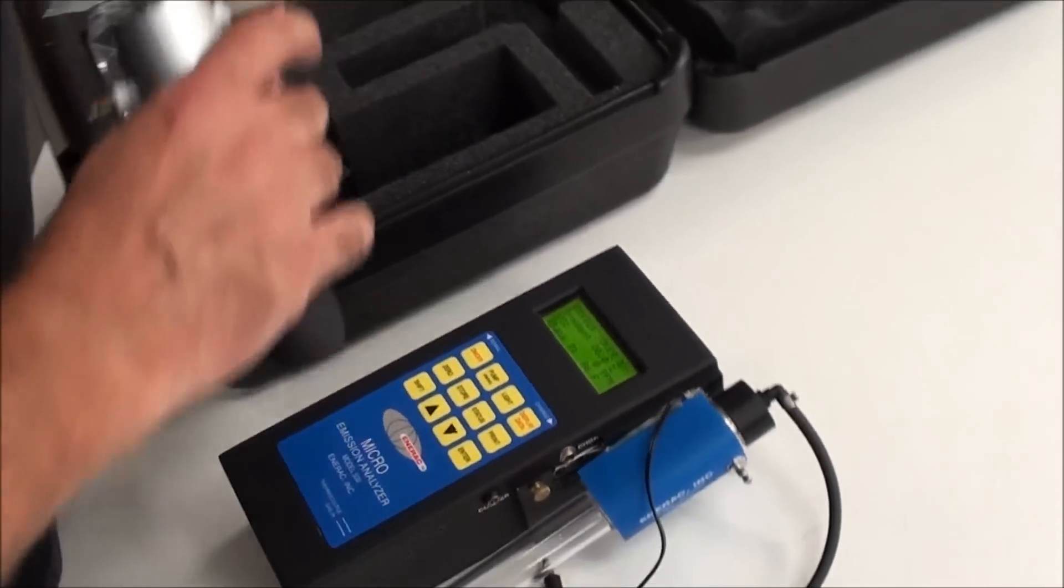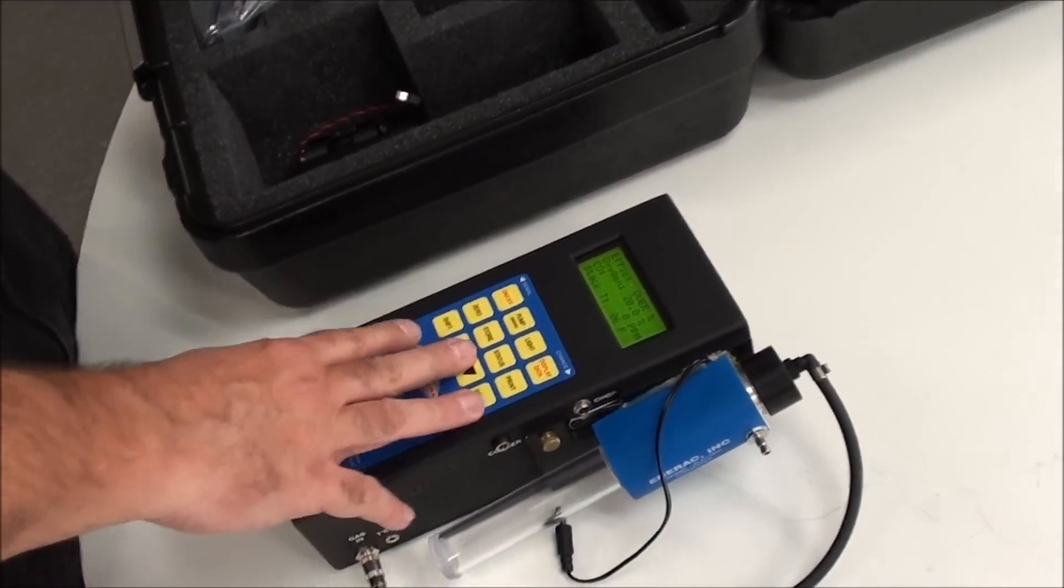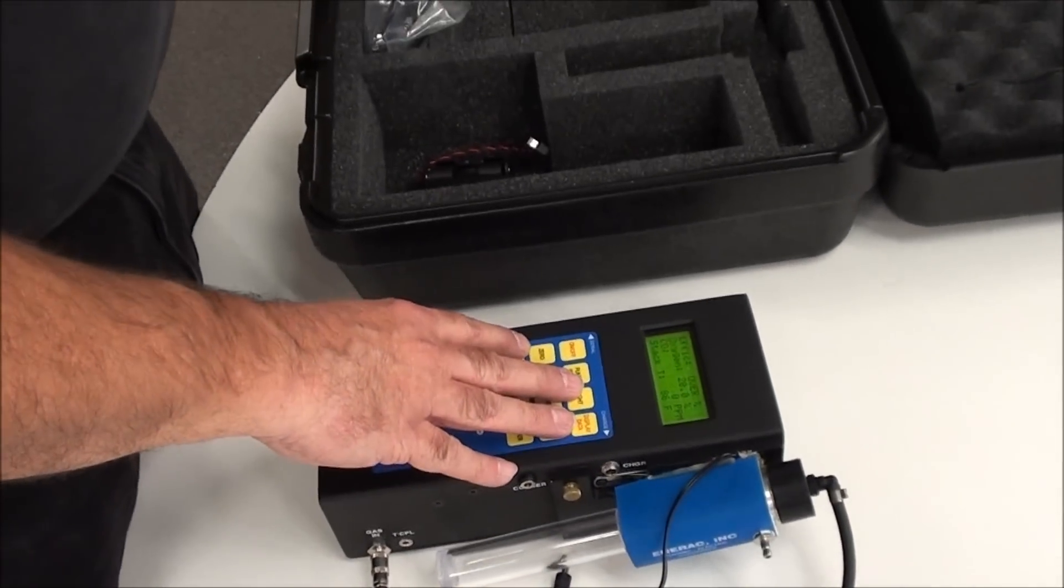Now what we'll do is we'll hook up the entire system. My recommendation is, before you start testing, charge the unit overnight. Give it a full charge. Make sure that you're on a powered outlet. Make sure that when you leave, that unit is charging.